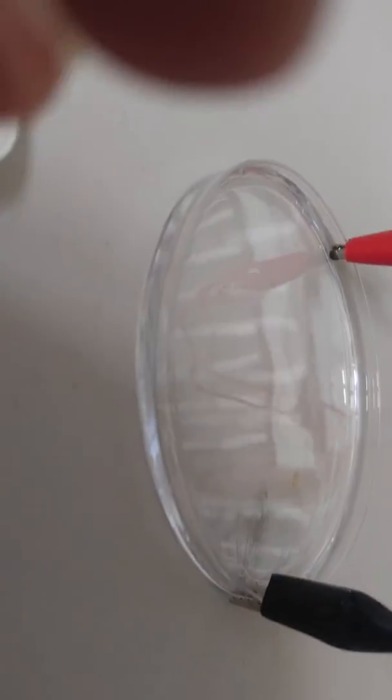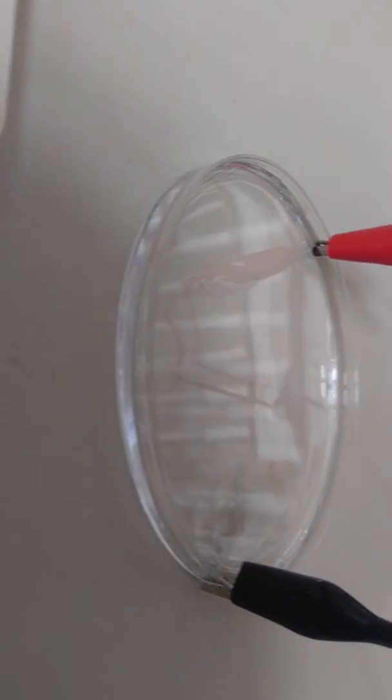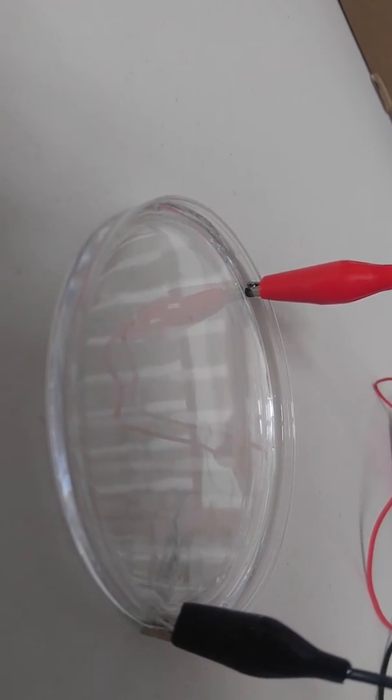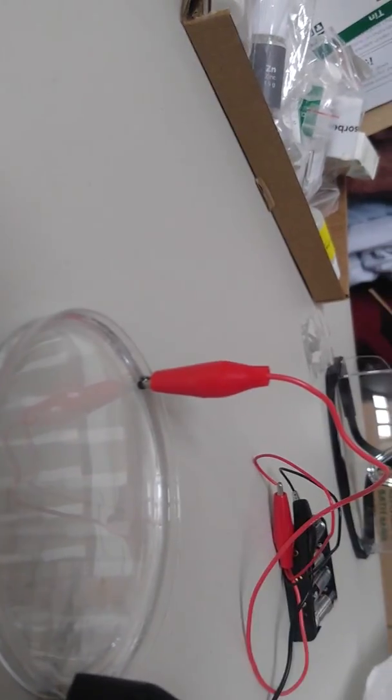Weird. Is it filming right now? I'm not sure. One moment. Yes, it is filming right now. But the other one, it's not touching the water. They're both touching the water. No, it's not. The other one's not touching it. It's not growing, but it's touching the water. Otherwise, this current wouldn't flow. And that wouldn't work.